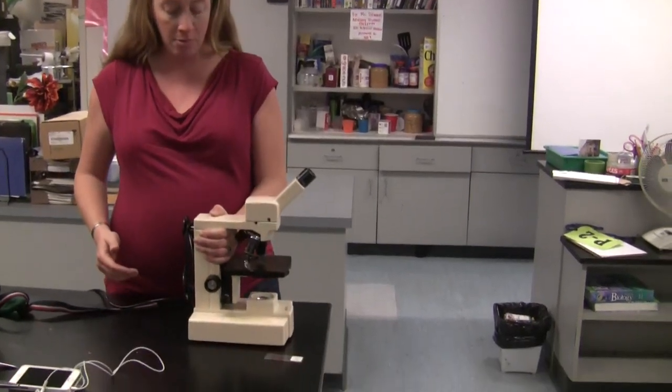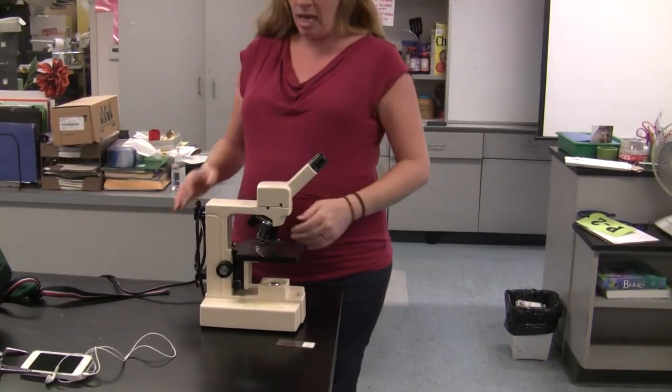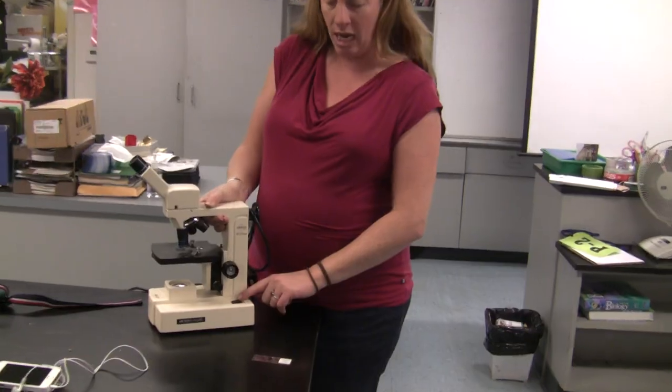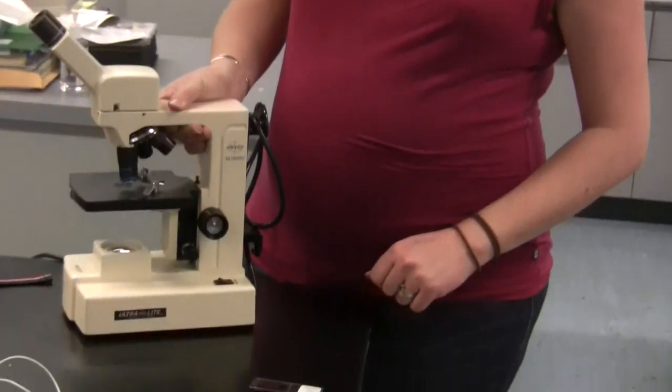And then go ahead and set it down, plug it in, and there is a switch on the side to turn on for the light.